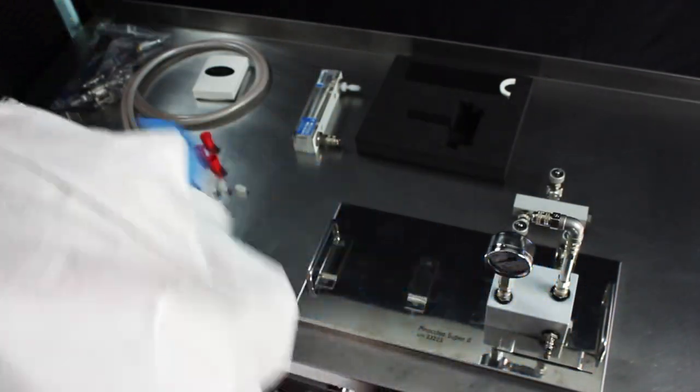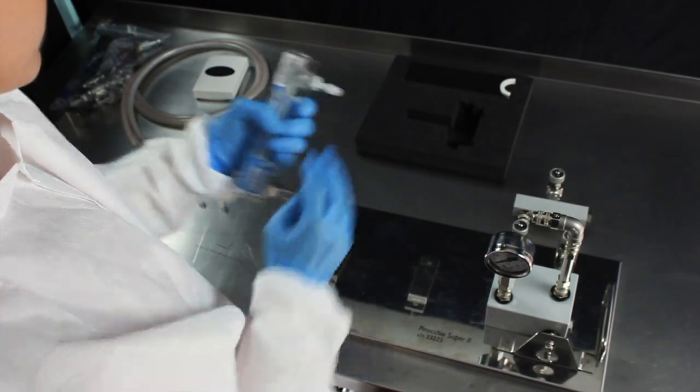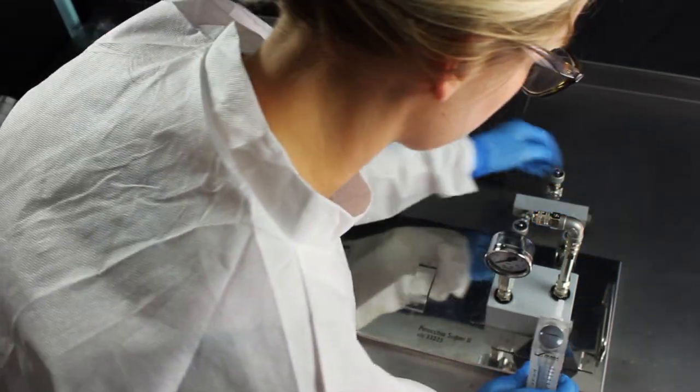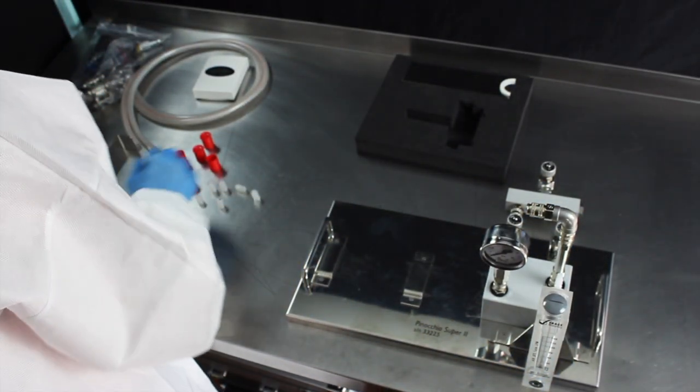For flow meter support, slide the small triangular stainless steel brace to the front of the central block. Connect the air flow meter to the front of the central block by feeding it through the triangular support bracket.